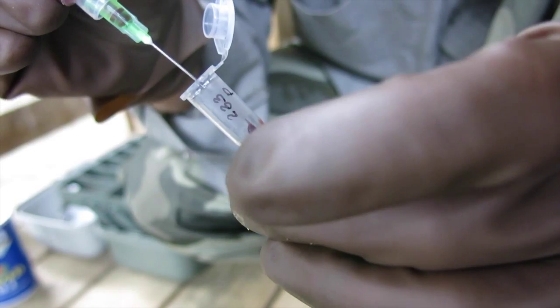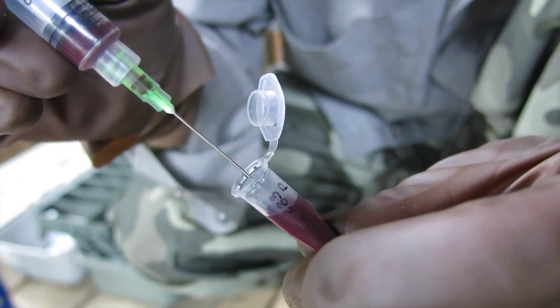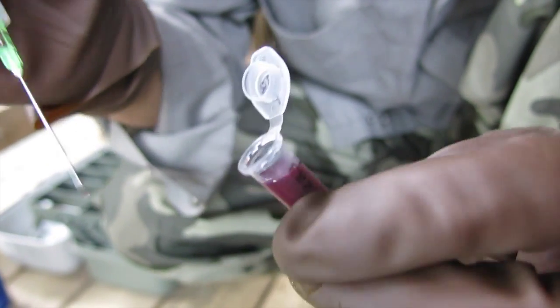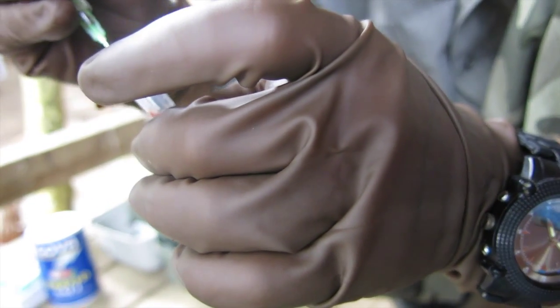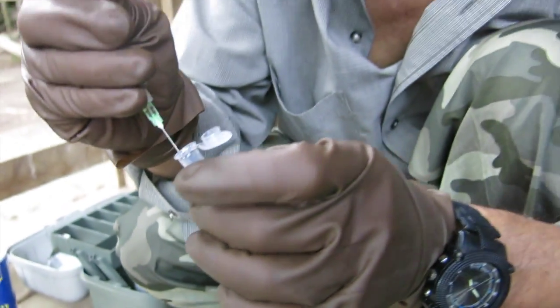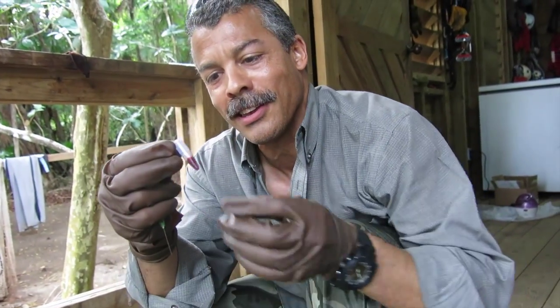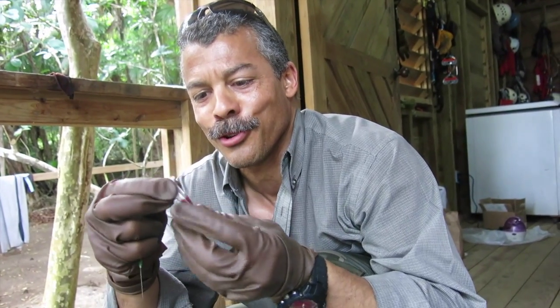Get it in fairly quickly so we can spin it down. A little bit more than a full tube, so we'll use another tube as a whole blood sample — about a half a mil there. In total, probably a little more than a mil and a half collected. That's a nice sample of fresh turtle blood.